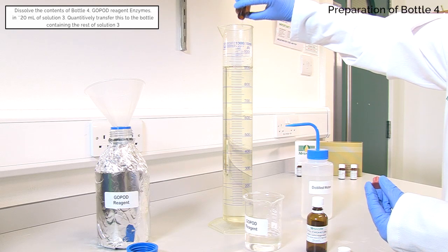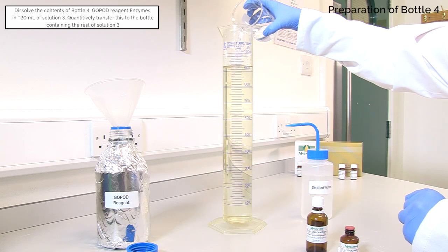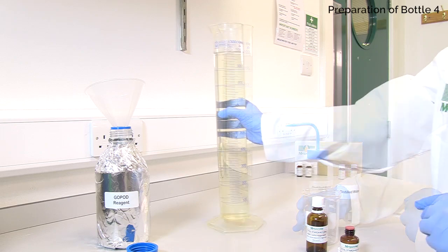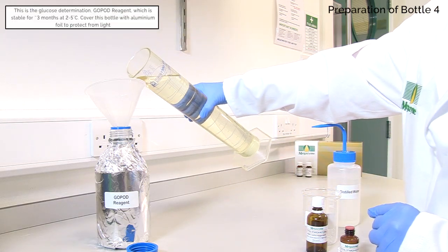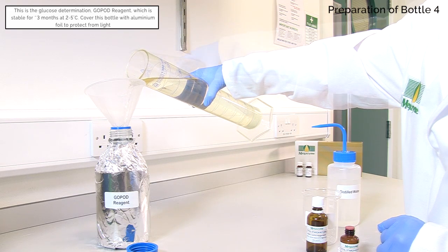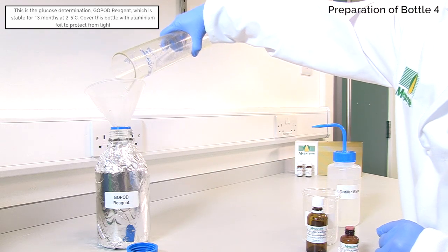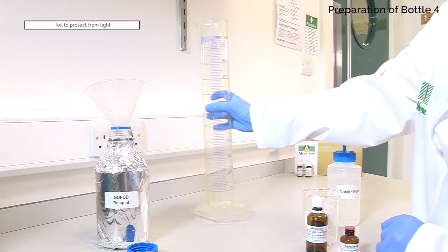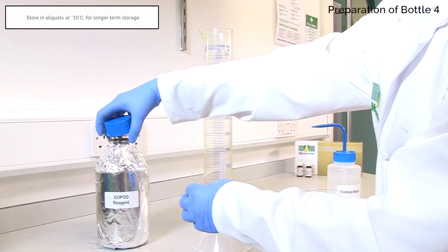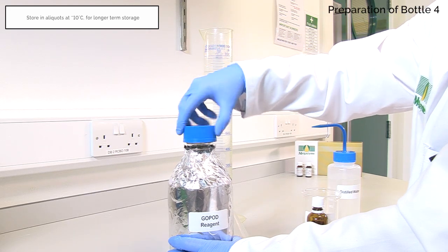The Glucose Determination GOPOD Reagent is stable for approximately 3 months at 2-5 degrees Celsius. Store in a 1 litre Duran bottle covered in aluminium foil to protect from light. For longer term storage, divide into approximately 250 millilitre aliquots and store below minus 10 degrees Celsius. This is stable for greater than 12 months at temperatures below minus 10 degrees Celsius and should not undergo more than one freeze-thaw cycle.